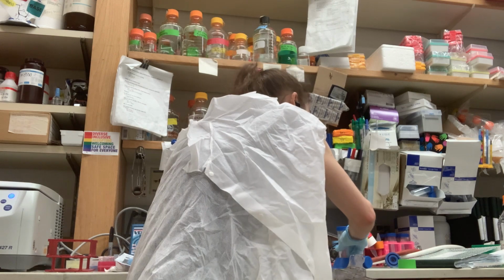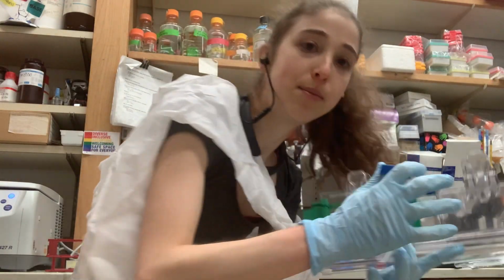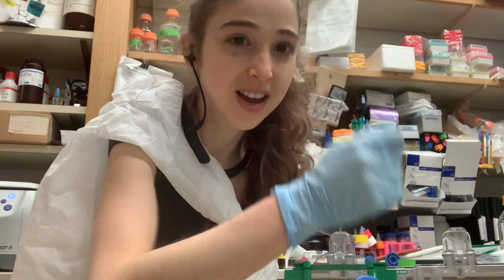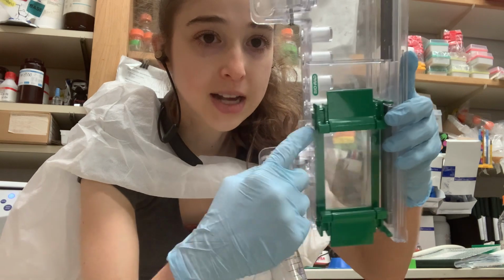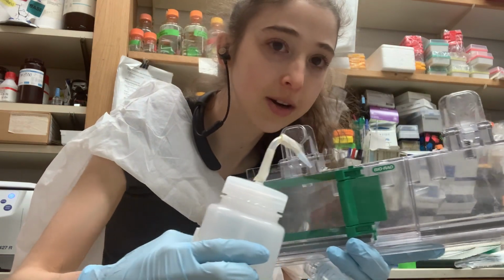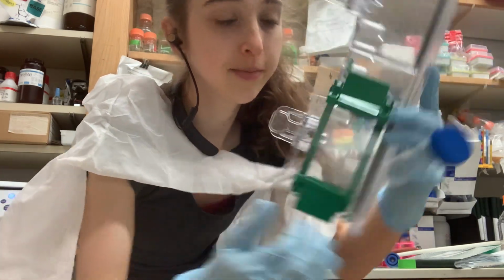And so typically to see when it's dry, I keep the excess. I make the mix in a falcon tube, and then I keep the excess in here, and I keep the pipette tip in here. And then when it's hardened, you can tell because the pipette tip will get stuck in the gel, and it's fun because then you can kind of play with it. But anyway, that's how you know it's done. You can then pour off the isopropanol and do a water wash. It's helpful if you have a squirt bottle. You do a water wash, pour it off, and then I should really try to dry it out. Just put a paper towel or whatever, and it'll suction out.